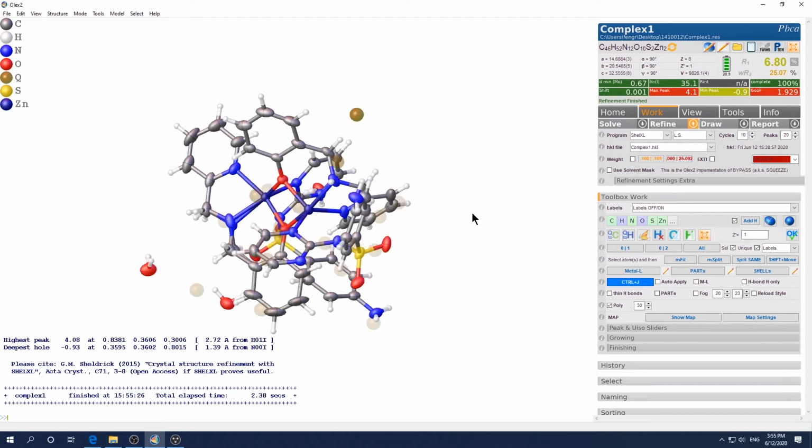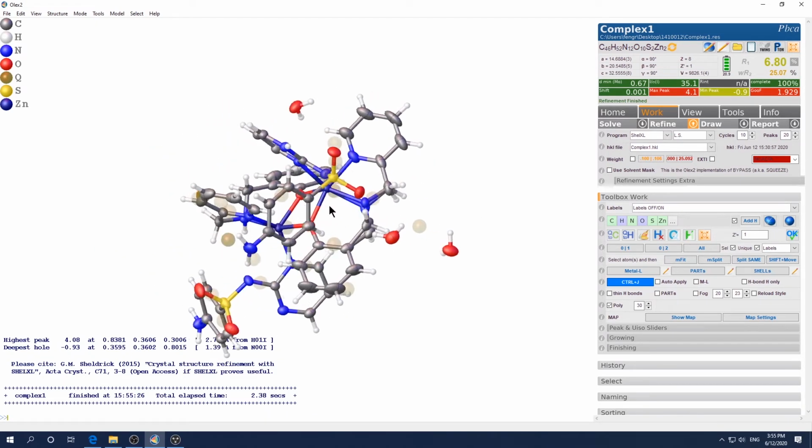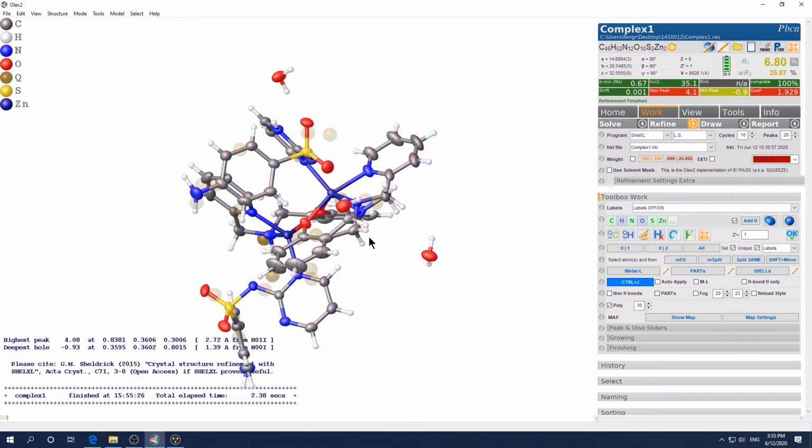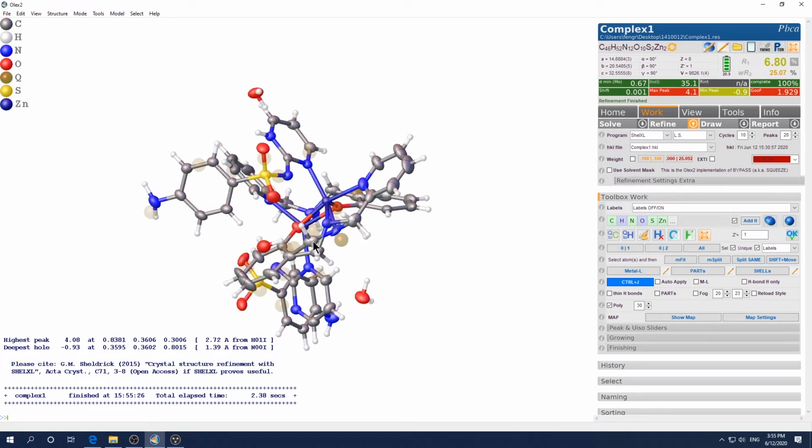So now let's check this other part. I want to see, this size looks better, matches better. So part 2 is pretty much 32%, and it's exactly the same occupancy because we tied them to part 2. So this is part 1. It's 1 minus that.